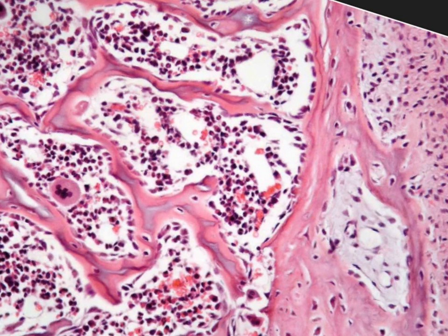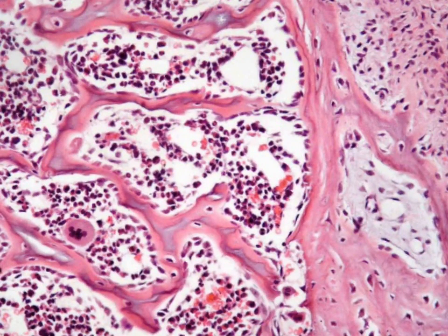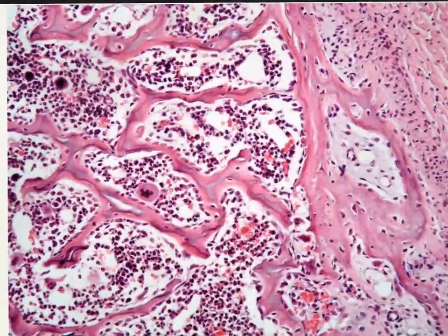This is a very nice picture for the spongy bone. Here in the spongy bone, we have the bony trabeculae. First of all, this is the picture with the original size. These are the bony trabeculae here, very evident. And in between we have irregular bone marrow cavities. In the bone marrow cavity, I can diagnose this large cell with a single multi-lobed nucleus. It is the megakaryocyte. And we have the different hemopoietic cells.